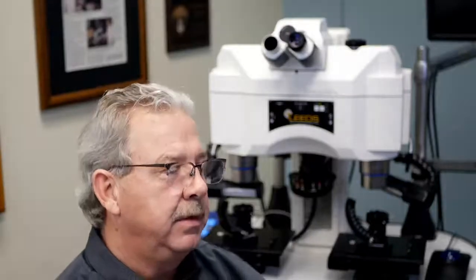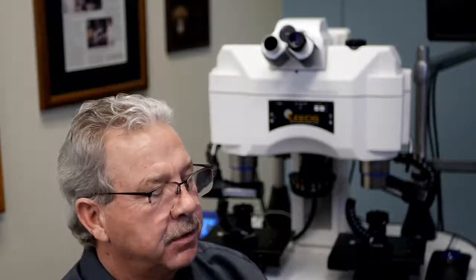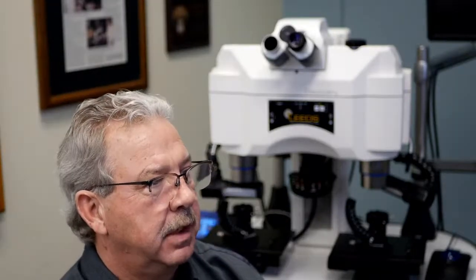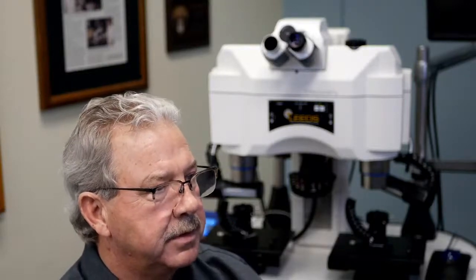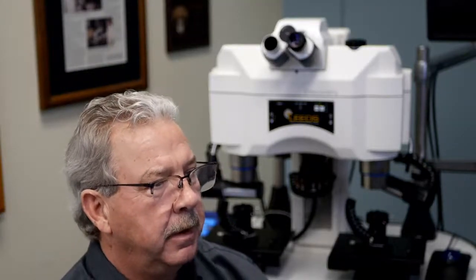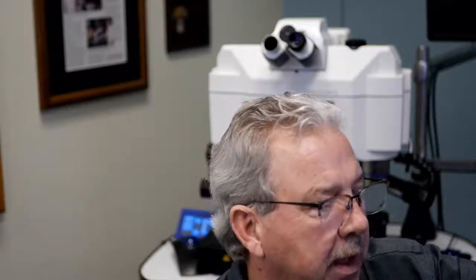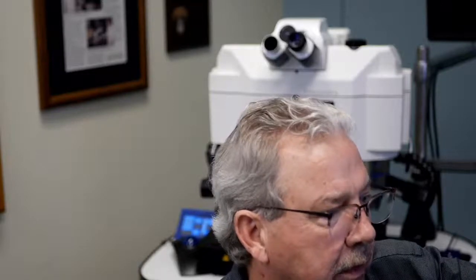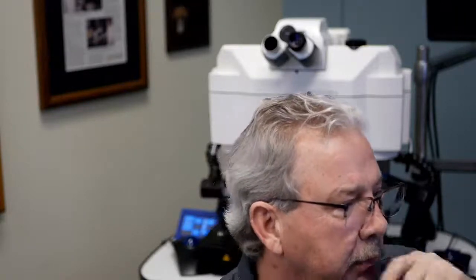Kevin, why are you spending this time talking about this? Well, what I want to show you is that a small field of view difference actually has a rather dramatic effect on the area that you're seeing. So I did a little bit of simple math here, remembering that the area of a circle is equal to pi r squared. And then I've listed out what an 18mm field of view would provide with a 1x objective, what a 20mm would provide, 22 and 23.